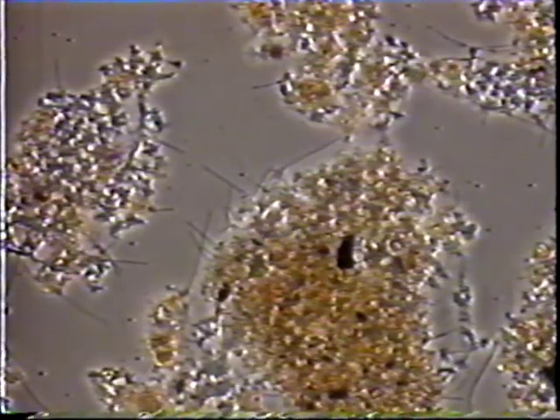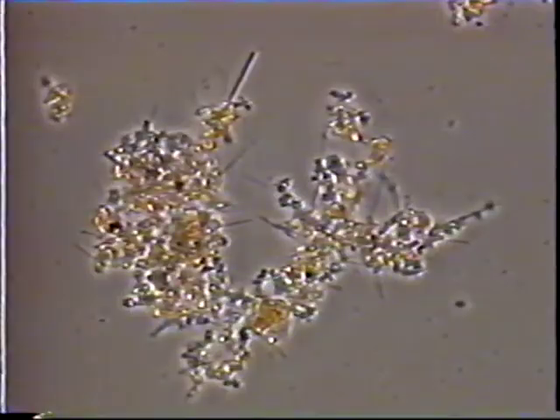Type 0914 causes interfloc bridging and may occur free in suspension as dispersed filament growth. Type 0914 appears as Thiothrix, but is usually thinner and has square-shaped cells. It is Gram-negative and Neisser-negative.